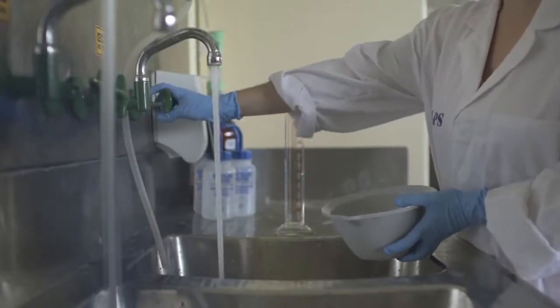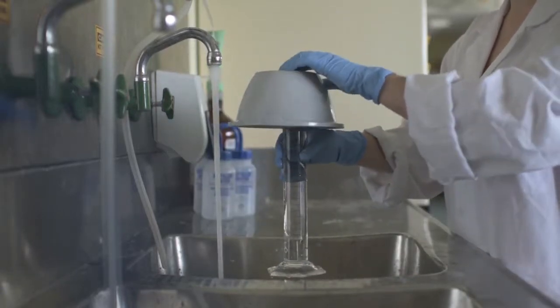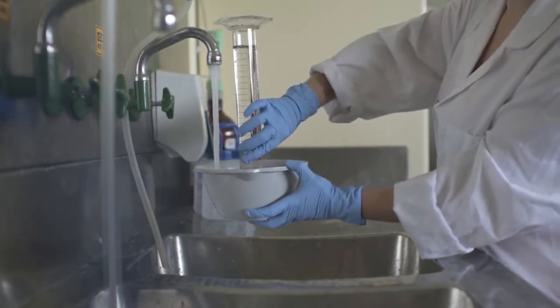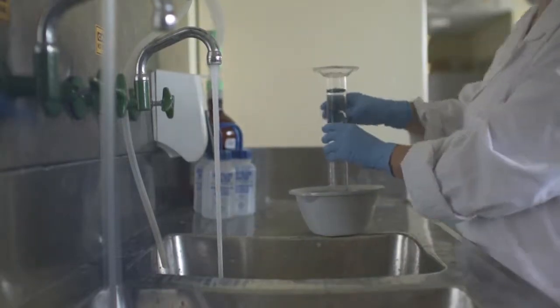To demonstrate Avogadro's law, a setup is needed. Firstly, go to the sink and fill a large measuring cylinder with water. Leave the water running and cover the cylinder with an ice bucket. Invert this, then fill the ice bucket to halfway with water while it's running. You may then turn off the tap and carefully transport this back to your workbench.